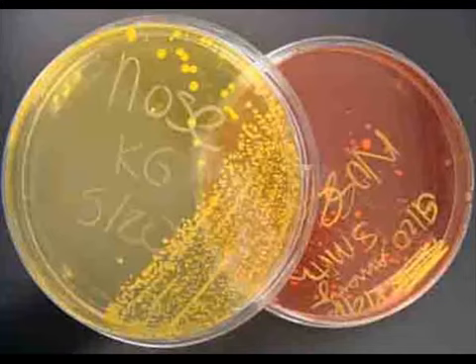The plate on the right also shows growth, which means there are halophiles or salt-loving bacteria growing on that plate. But the bacteria growing on this plate are not mannitol fermenters. We know that because the growth did not trigger that change in the color of the medium from pink to yellow. This medium remained pink, indicating non-mannitol fermenters, most typically normal flora like Staphylococcus epidermidis.